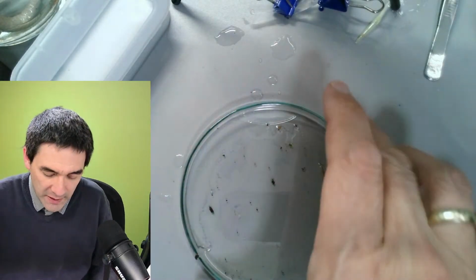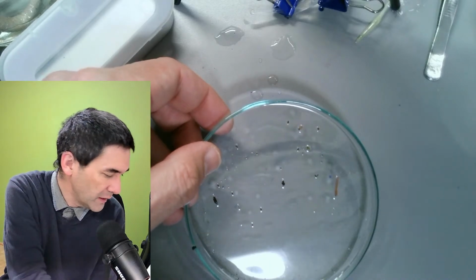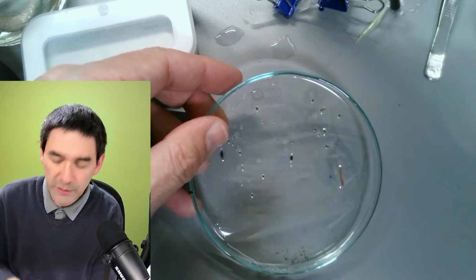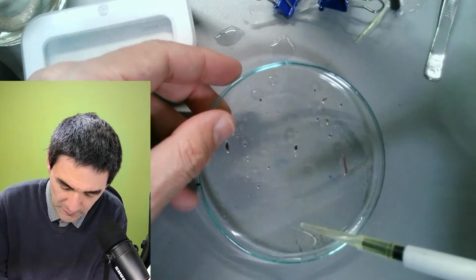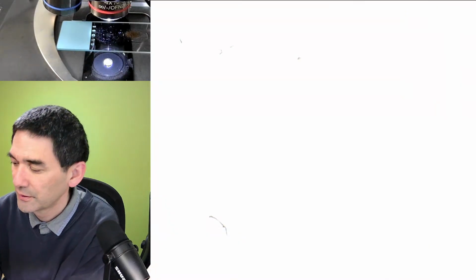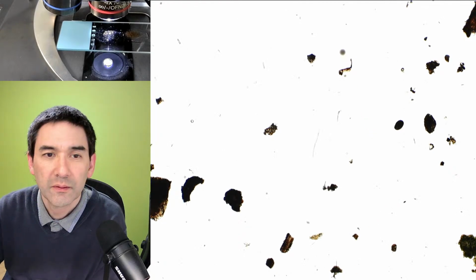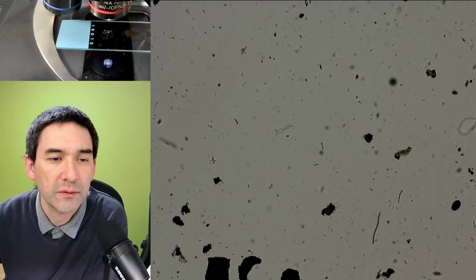So what we can try is, we can also try to put something from here under the microscope. Let me quickly put the micrometer slide away, and I have to put it into the box. Okay, yeah, but you see there is not a lot here, so you know what? I do the following. I take something here. Again, I do not have high expectations now, okay? This is again just a little bit of a proof of concept. And then I go here, and I put it directly on the slide. And that's basically what I've washed out just now. Yeah, you get the idea.